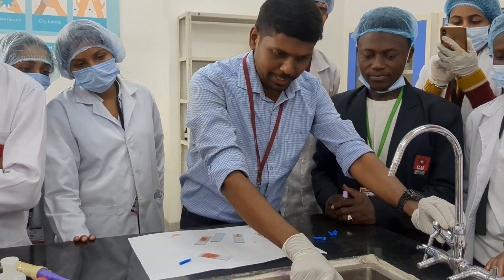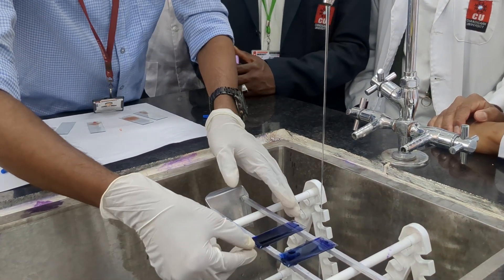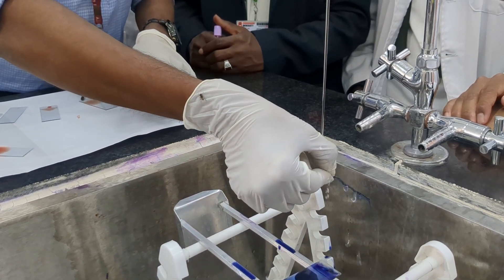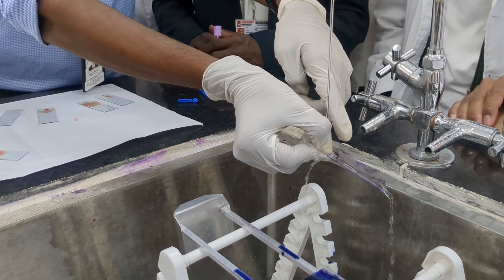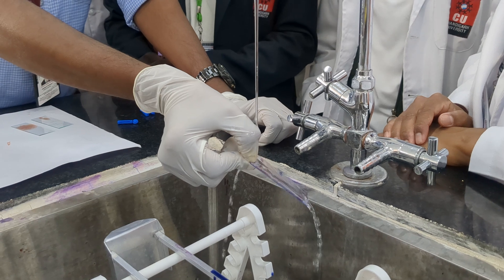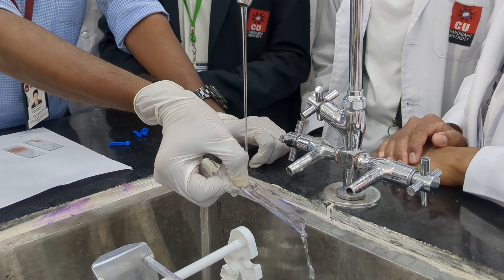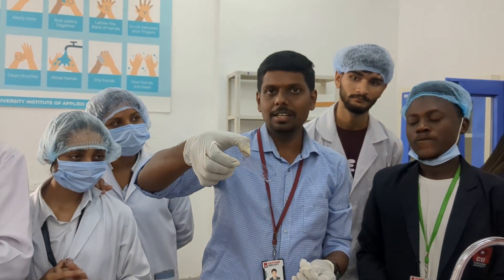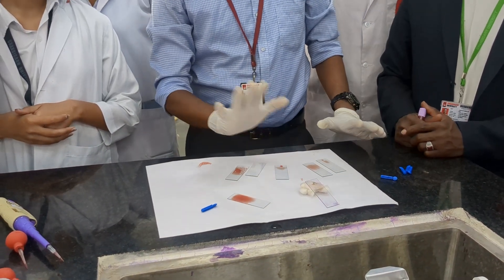Now a very important step. Open a smooth flow of tap water. Hold the smear from the head portion — your finger should be here, and the water should flow through the finger over the slide. You should not directly contact the smear; rather, clean the slide with your finger as a holding agent. Gently clean the slide under running tap water for one to two minutes until the color fades away. We already washed the slide — now it is almost transparent. Allow it to air dry under normal air for a few minutes until the slide is completely dry.